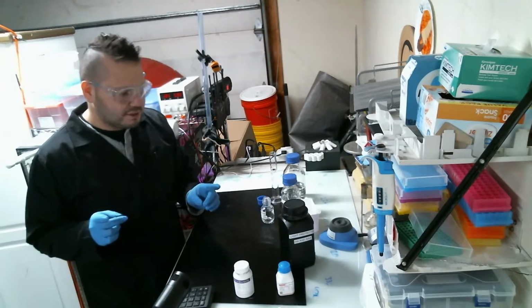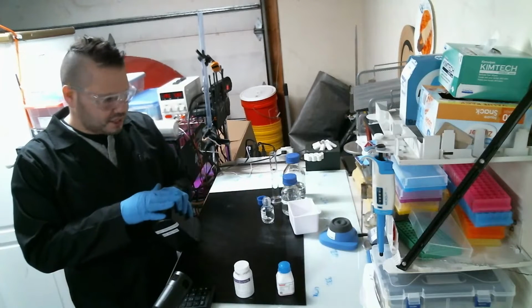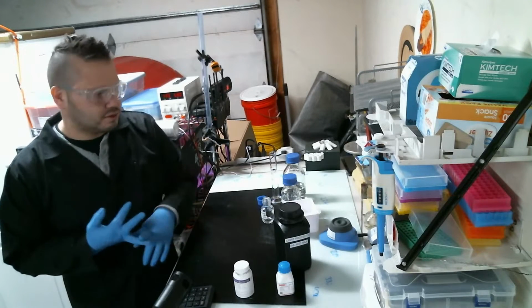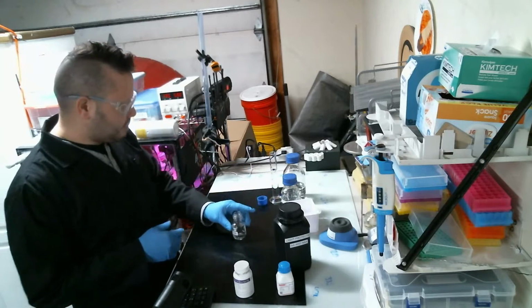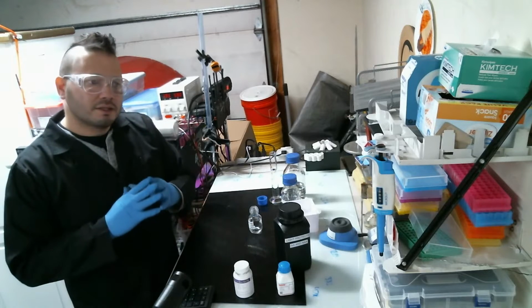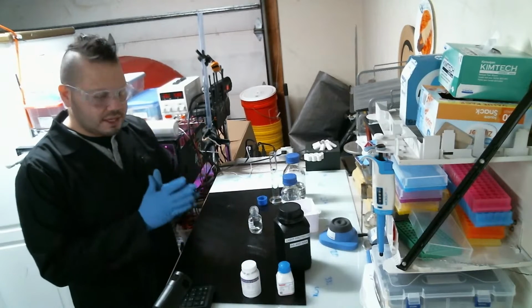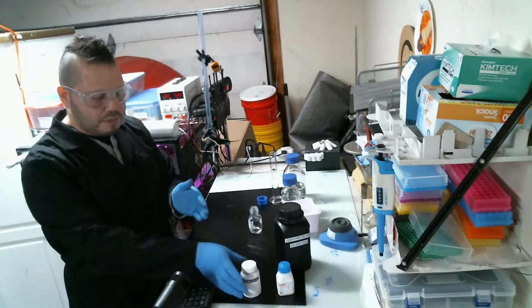And there's a difference, because in these vials, I'm not going to take it out, but in the vial, you have sodium hydroxide and some culture salts that the algae grow in, right? Because the solution isn't just the hormone, I have to essentially simulate everything that's going to go into the experiment minus the hormone.